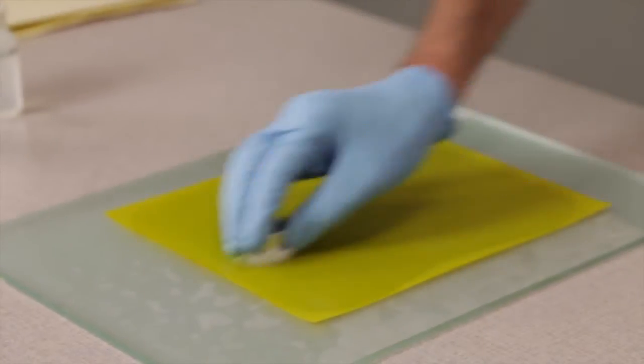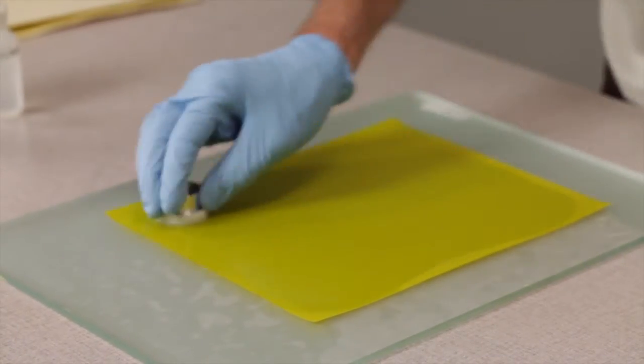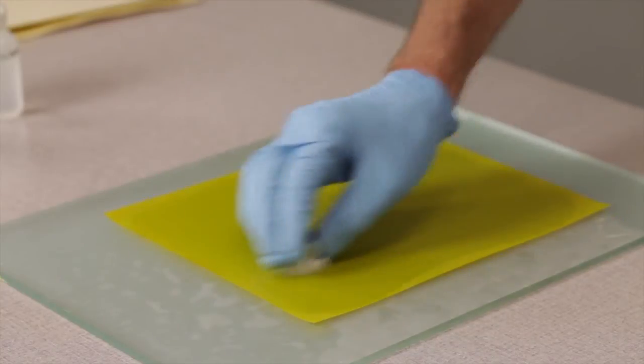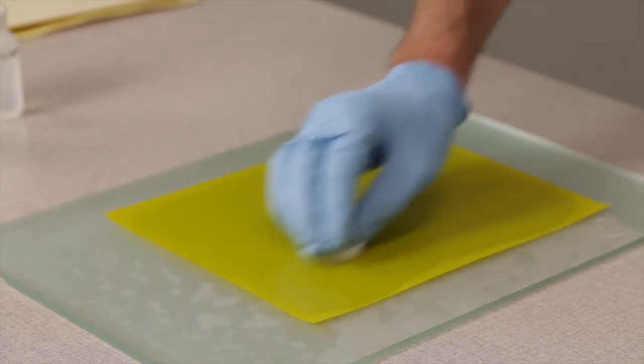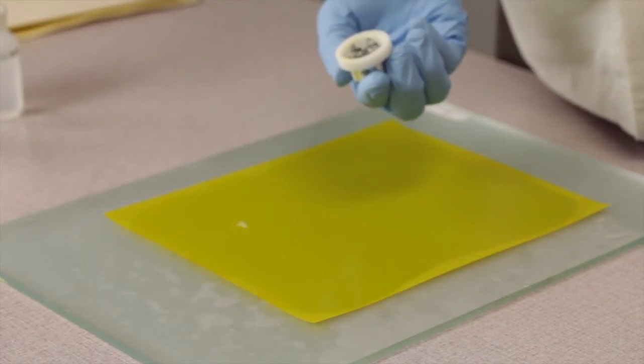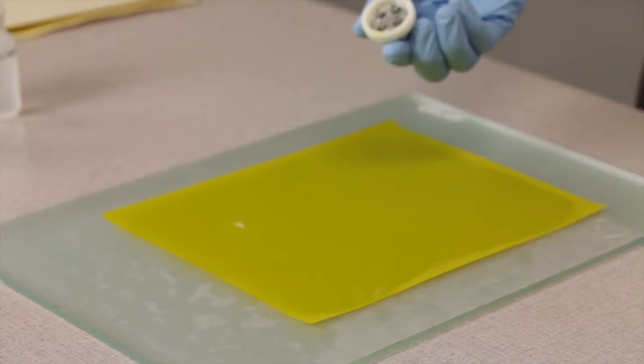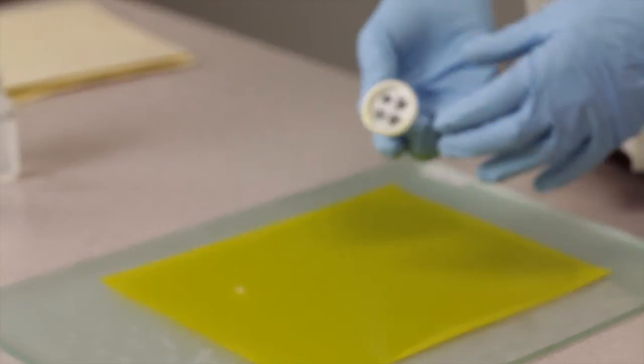The first stage is the longest. It might take a couple of minutes to do this. But you're doing four samples at once. So it's really only 15 seconds apiece.